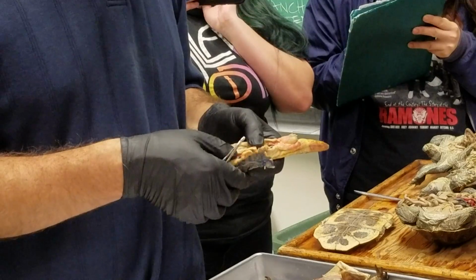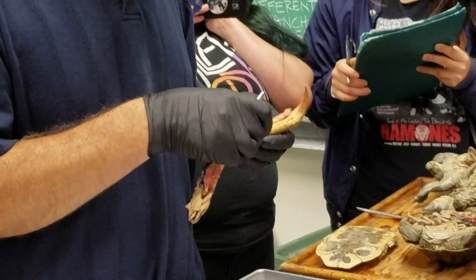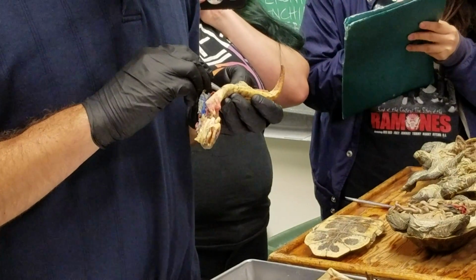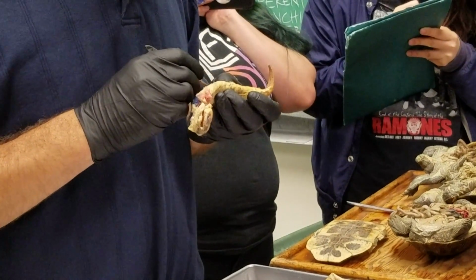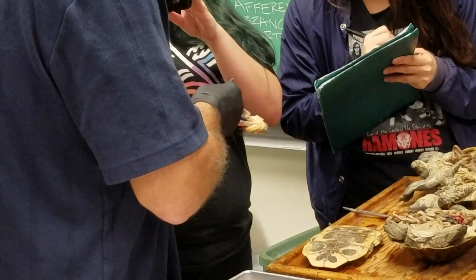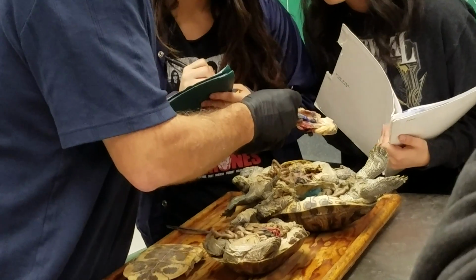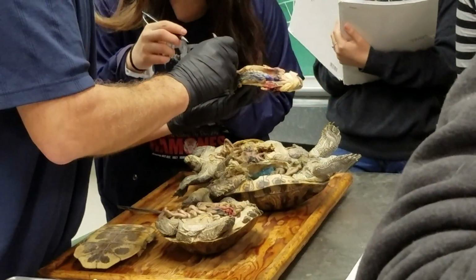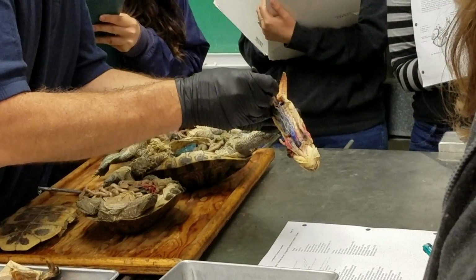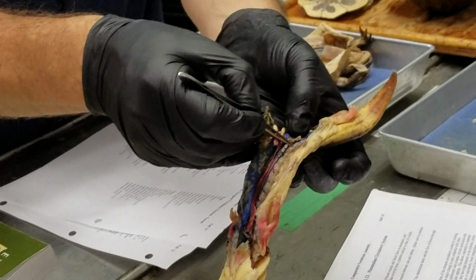Renal portal vein is the vein that runs along the side of the kidney. And in a male like this, you'll find it just down right below the archinephric duct. So if we lift up the archinephric duct and look there, we will see the renal portal vein running along. It's in blue here. Not always injected, but this one it is. It's the one in the middle? This guy here. Oh. This one right there. It's the renal portal vein. This one here. Okay.